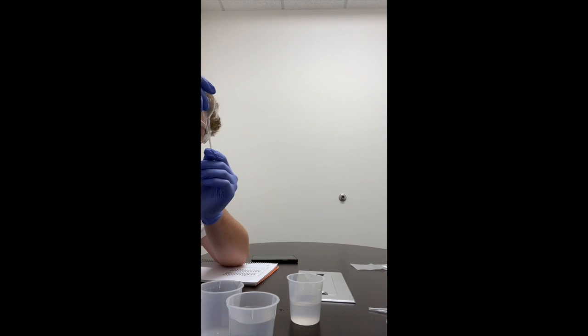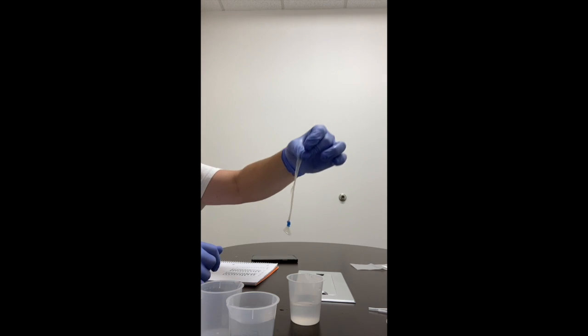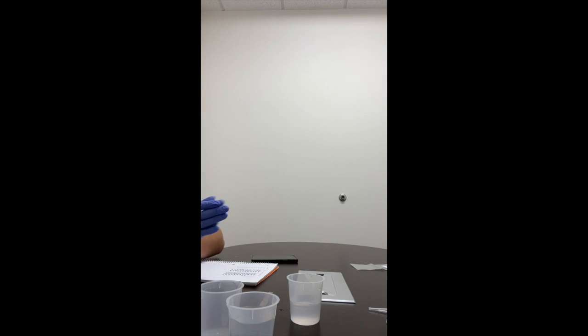So we have a stoppage. We'll do it another time just to get it around the correct spots. Maybe do it one more time. Make sure it's really tight at the bottom. I think that's tight. So that's what this looks like. And we'll lay that down. Let it dry a little bit.